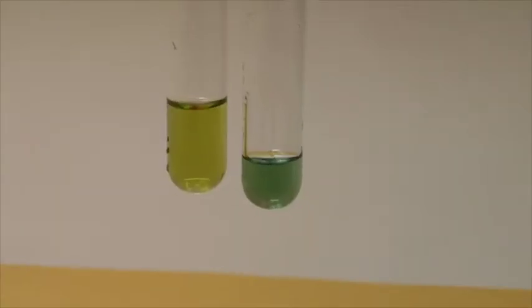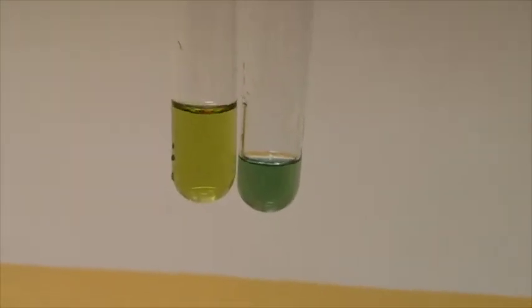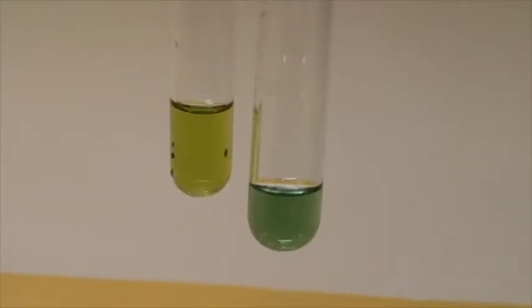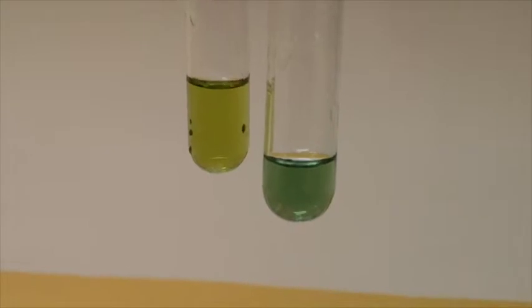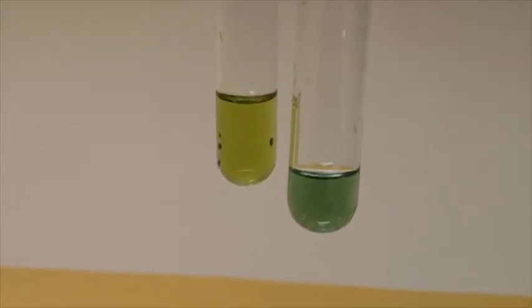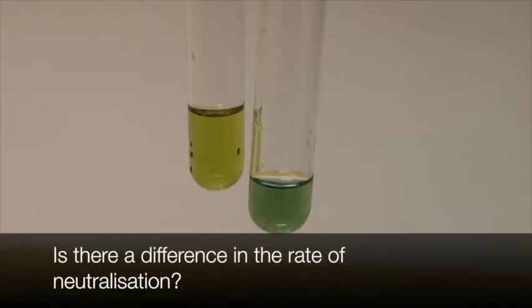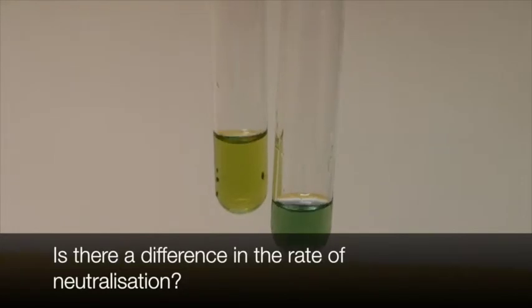So if you compare the 0.1, it's really neutral, but this one, the 1 mole, it became slightly alkaline already. So is there a difference in rate? Yes. What the difference is? You tell me. Okay, bye.